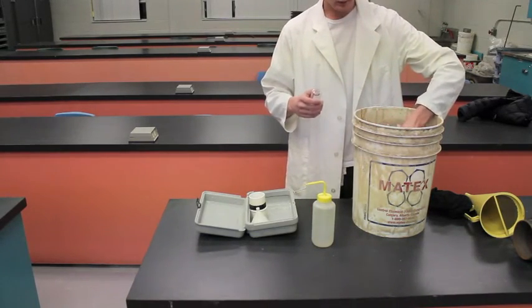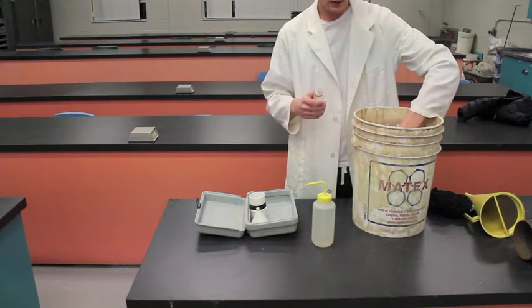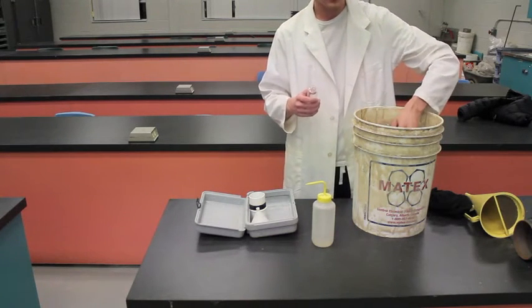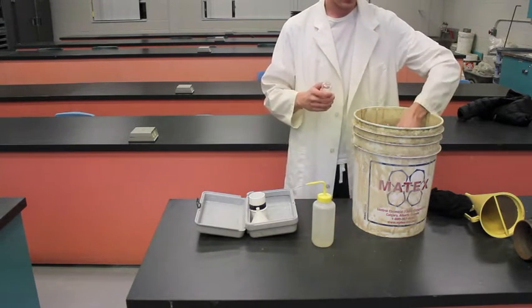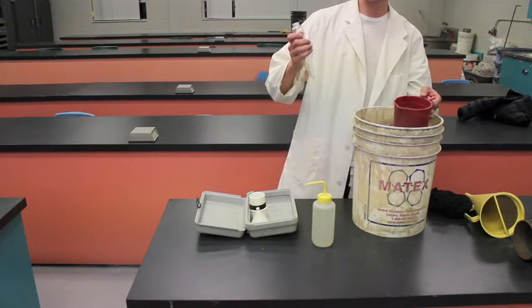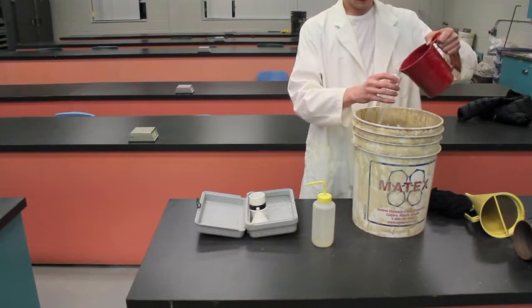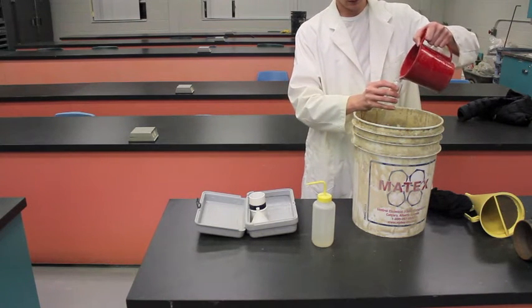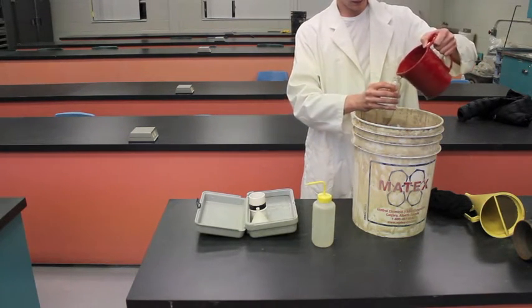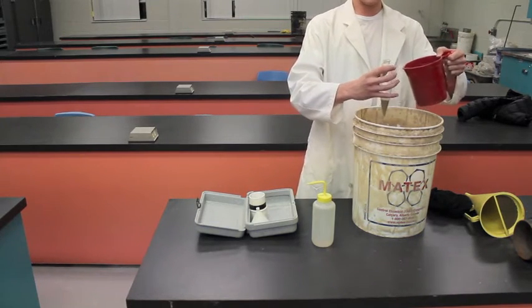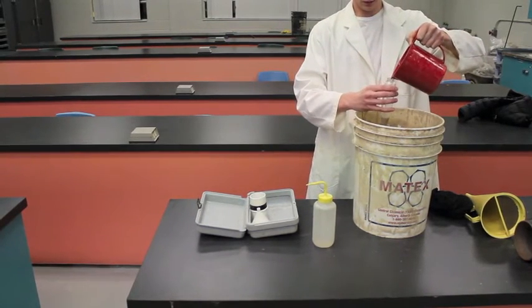So, it's very important that your mud is continuously mixed, and that you fill up to the mud to here line, and this will give us an exact sample. So, it's always good to just be nice and slow with it, allowing the stuff on the sides to fill the tube.